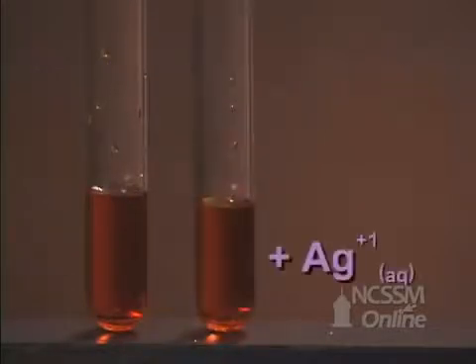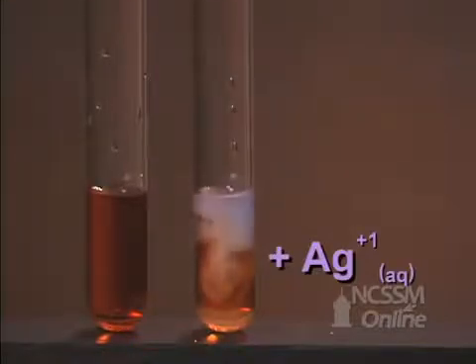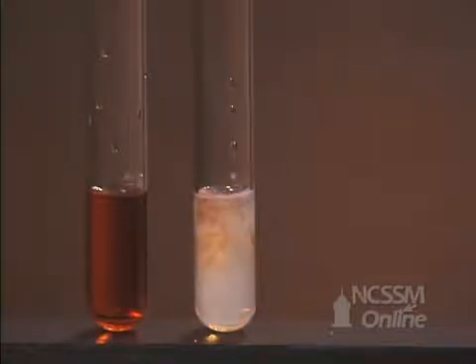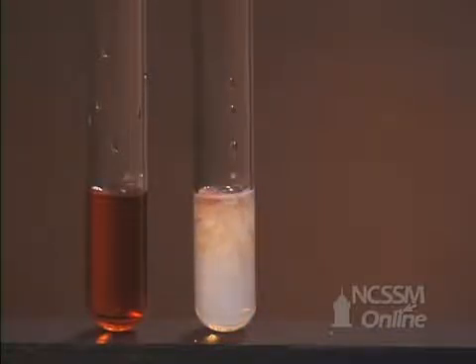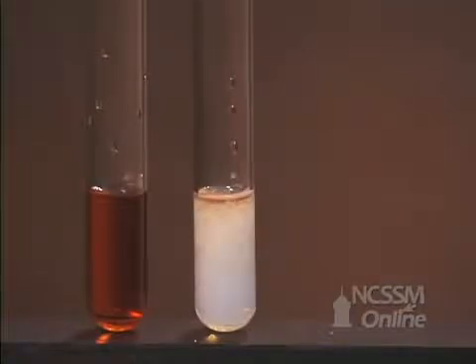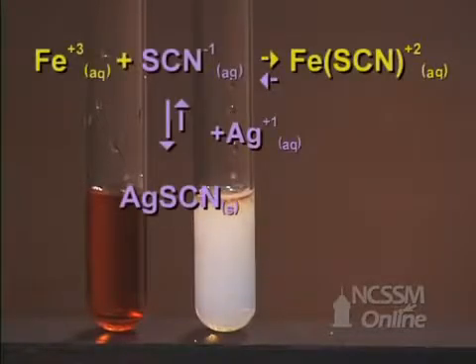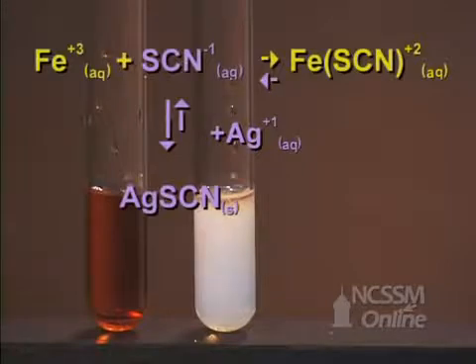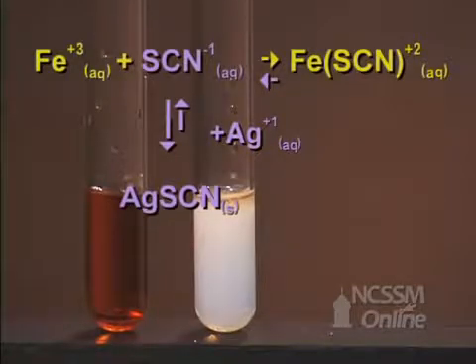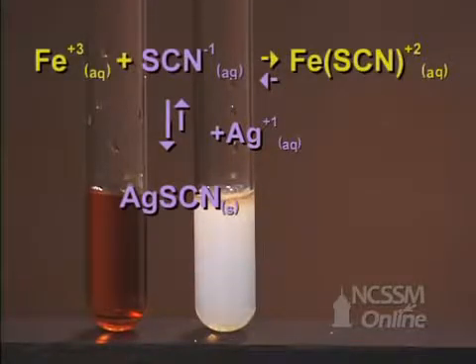We will now add 0.1 molar silver nitrate to the reaction mixture. We notice the disappearance of the red color, which indicates that the equilibrium has shifted in the reverse direction. We also see the formation of a small amount of white solid. The silver ion reacts with the thiocyanate ion to form slightly soluble silver thiocyanate, which is the white solid. The silver ion removes thiocyanate from solution, and the equilibrium shifts in the reverse direction to try and replace the thiocyanate ion that's been removed.